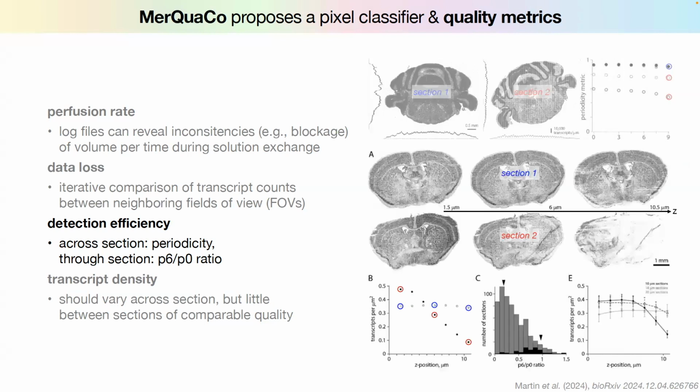Similarly here, this is the P6 to P0 ratio. So that's the Z stack. Again, these are 3 Z coordinates. And then they say this one is pretty stable. But in this one, basically, we don't really get any transcripts anymore. So that's really bad. Yeah, I thought this was quite interesting. I don't know yet how to apply all of these things because it's very specific to their data. But I think the ideas that they propose are quite interesting.